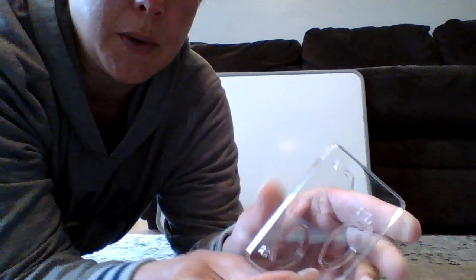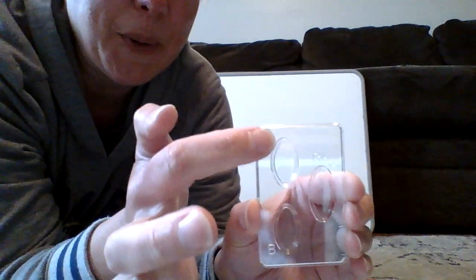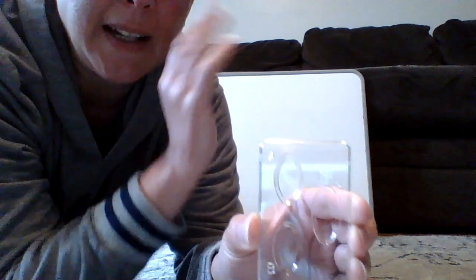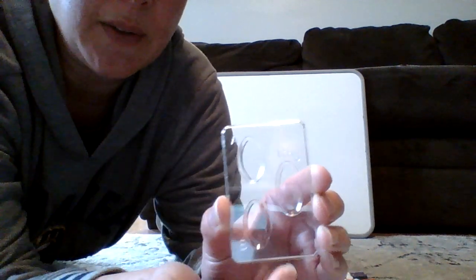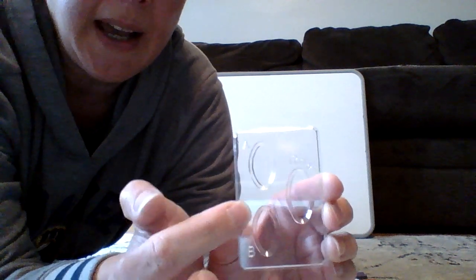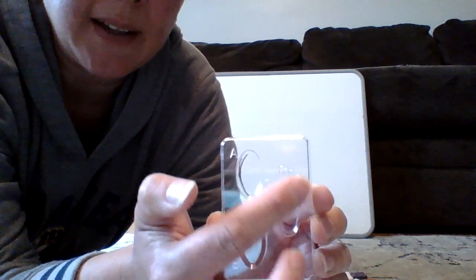So what we do is we use these little well plates. And on the well plates, it's just a plastic thing. In a lab you wouldn't necessarily use something like this if you're in an actual lab. But you've got an indentation that says A, you have an indentation that says B, and you have an indentation that says RH.